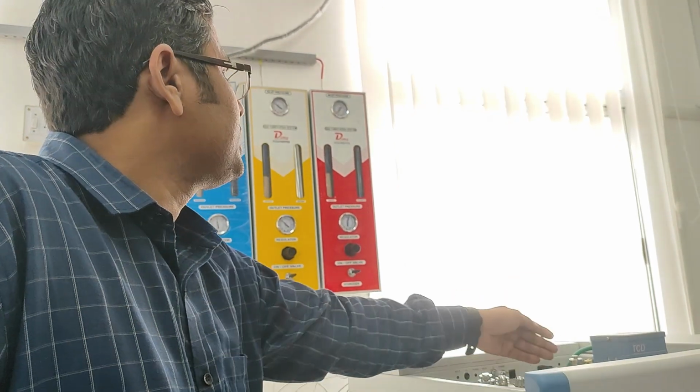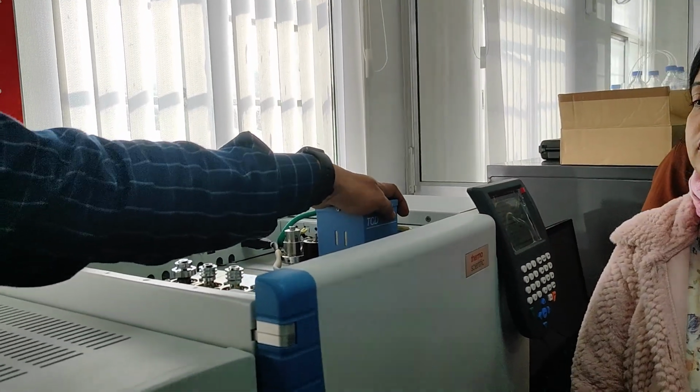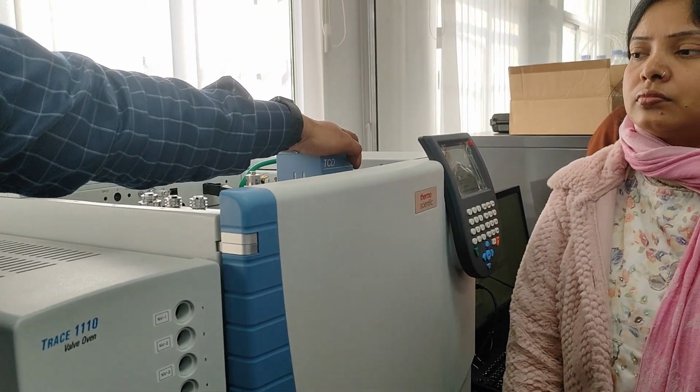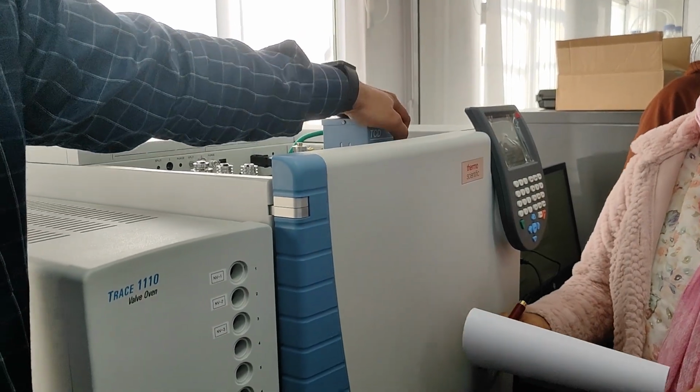We have no option. The FID cannot detect hydrogen, ECD cannot detect it, only TCD can detect hydrogen, and we want to detect 100 ppm hydrogen. So we have to inject a large volume of sample. At that time I can change the loop. We have different size loops.